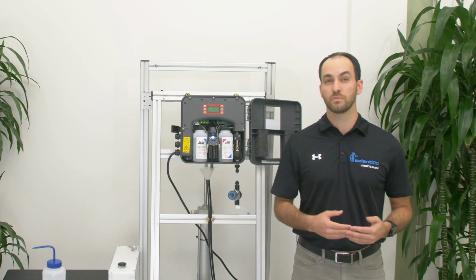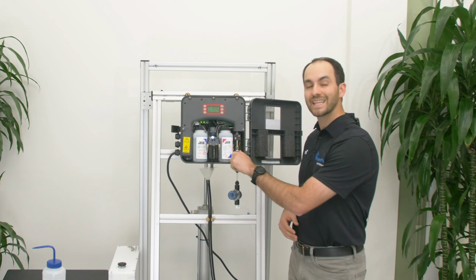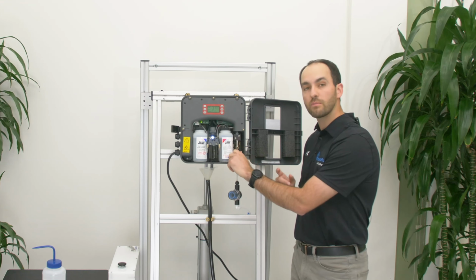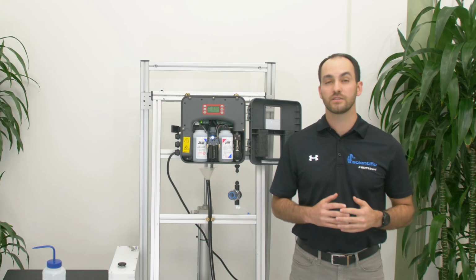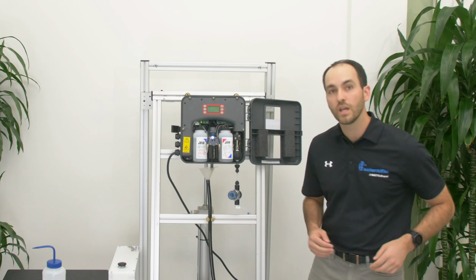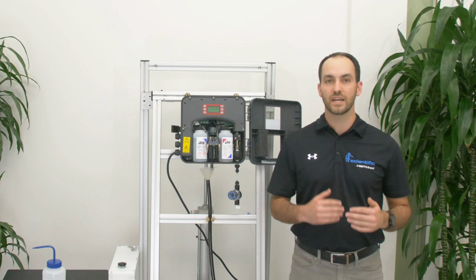To fix this issue, we need to adjust the regulator by turning the regulator to the left. By turning the regulator to the left, we're actually letting less water in. We need to remember that the regulator is not like a normal valve. Left means less water and right means more water. The next thing you want to do is to visually inspect the cuvette during the flow test. Make sure you can see water coming into the cuvette in a stepwise fashion. The water should not be flowing steadily into the cuvette, but instead coming in very small, distinct increments.